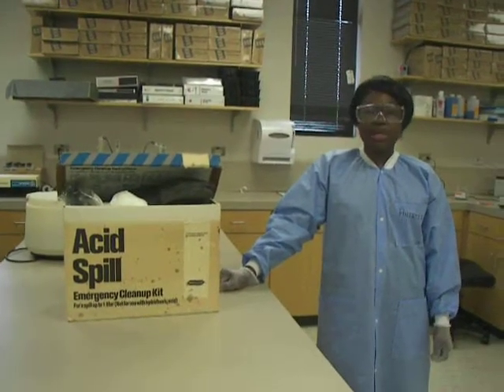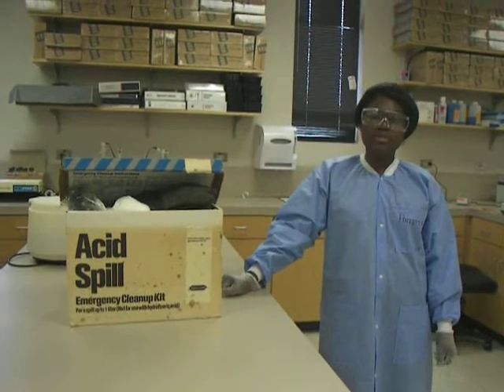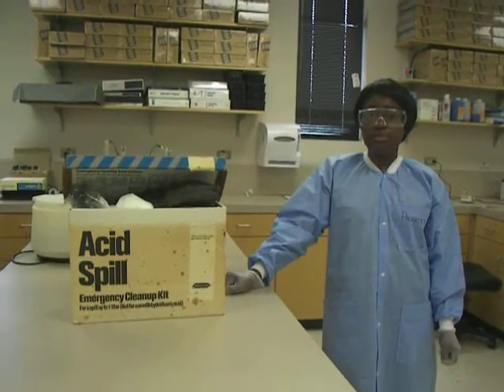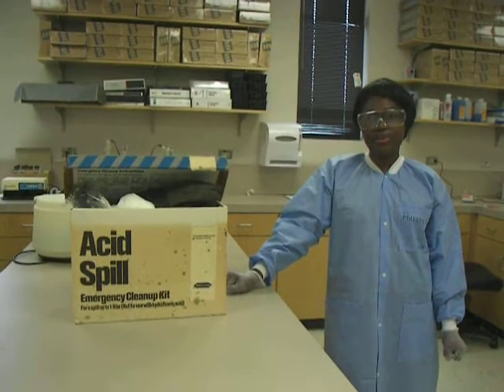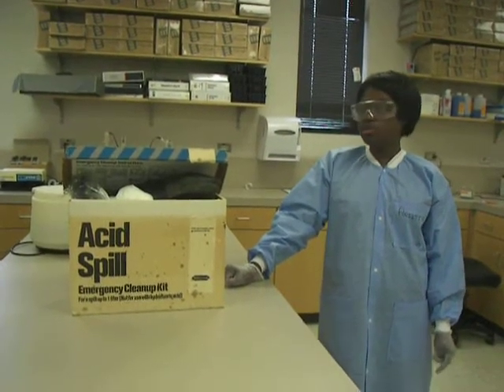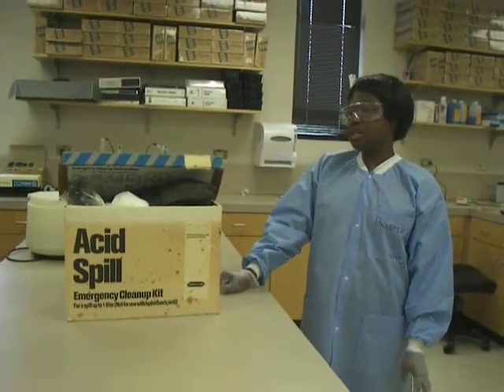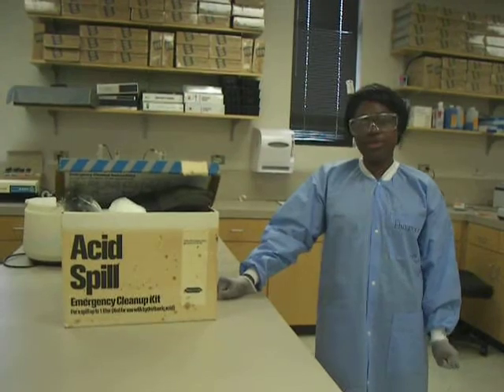I am going to talk about chemical spills and waste spills. When spills are involved, safety is very important. That is why I am going to cover ways that we can manage these spills in the laboratory.